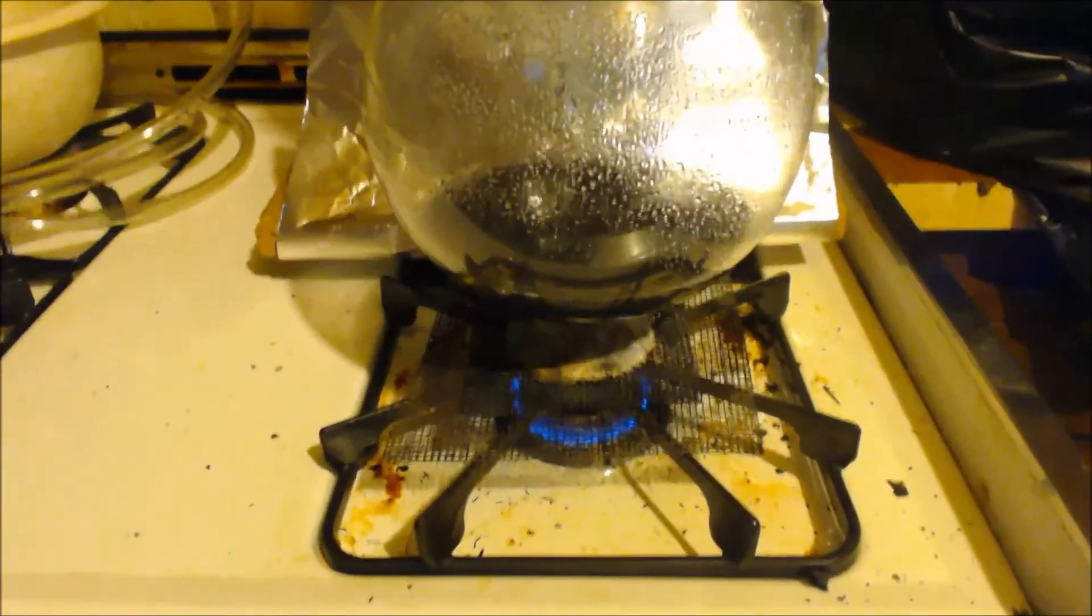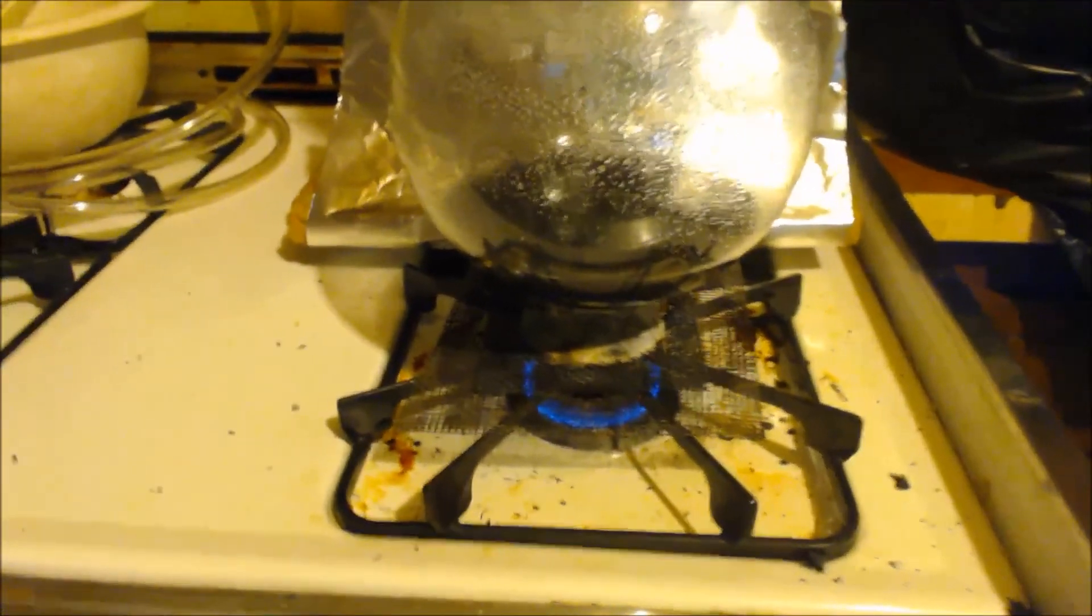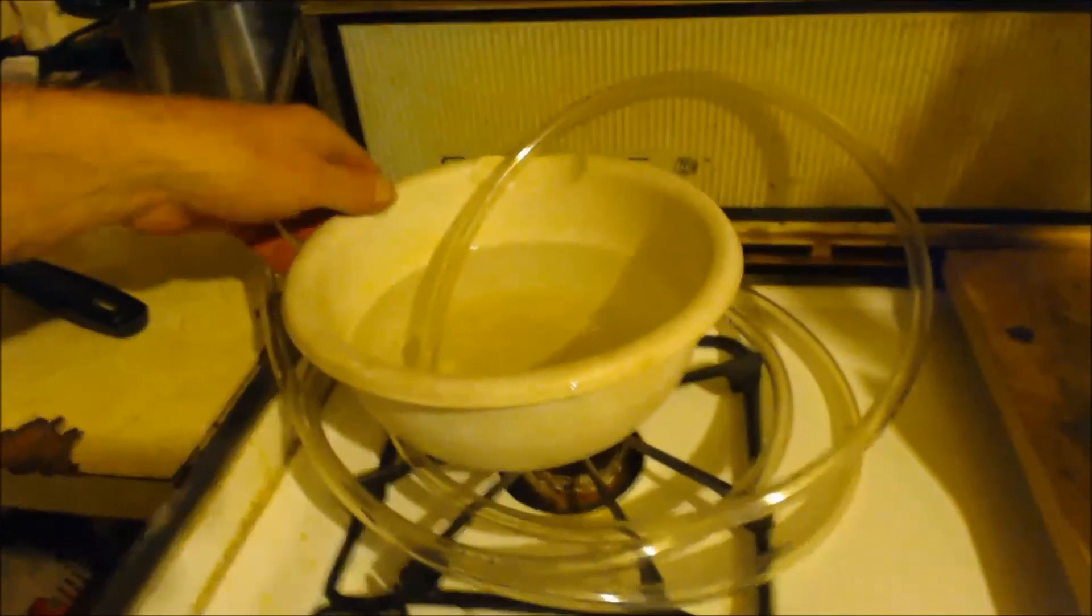But watch when I shake it. Let's see it bubble. Just a little bit, you know what I mean. But it's still bubbling. So let's heat it up. Holy crap, like within a second of putting that heat on, it's starting to bubble big time now. I don't know if you can see that.